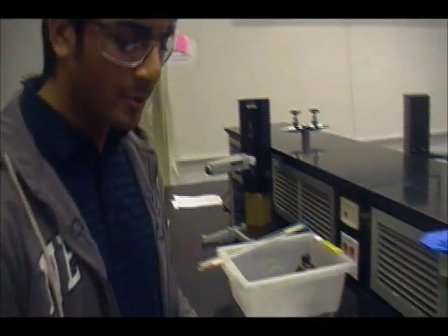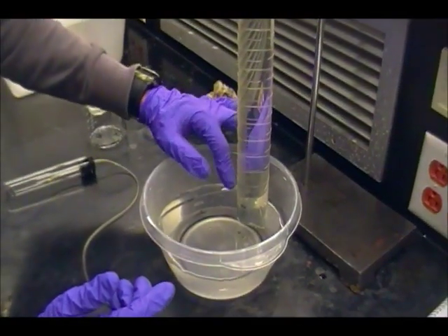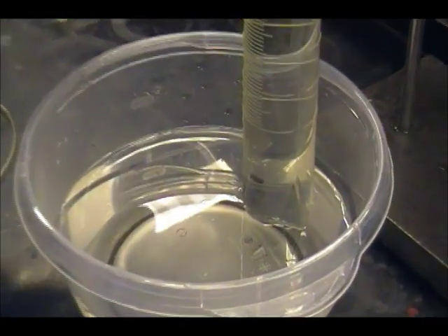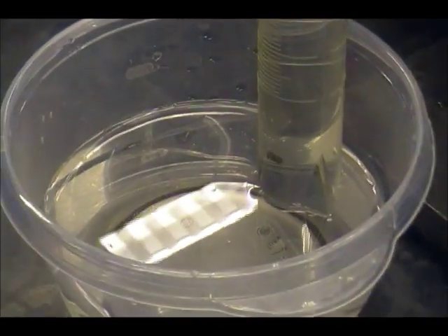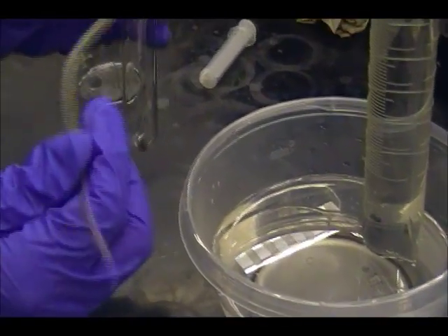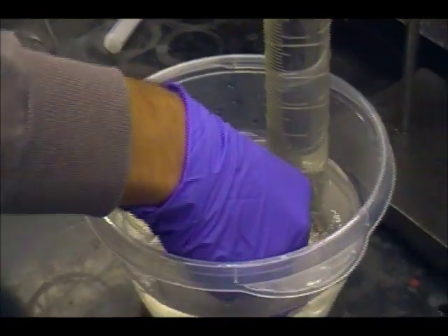Alright, for this next step, we'll want to raise the graduated cylinder as much as we can while keeping it still submerged in the water so that none of the water in the cylinder falls out. Raising the graduated cylinder higher up makes it easier to feed the hose connected to the black neoprene stopper in the connection to the test tube into the graduated cylinder. Make sure the hose is fed at least 2 inches into the graduated cylinder.